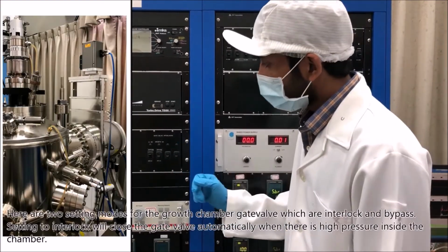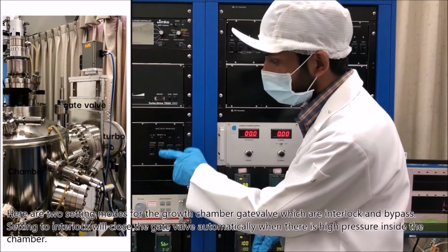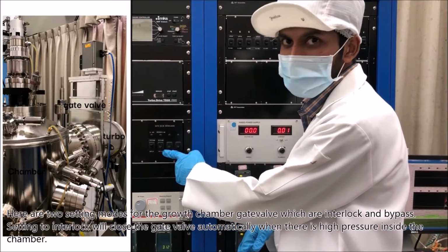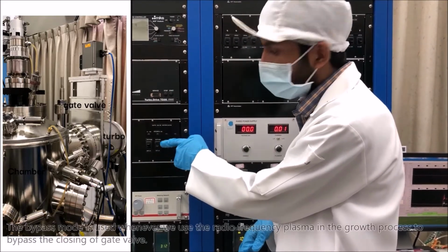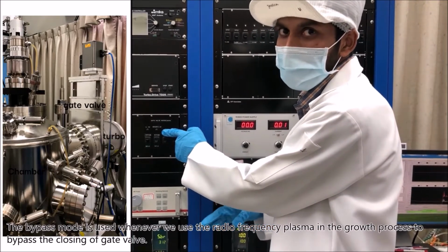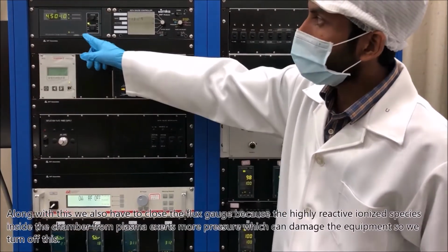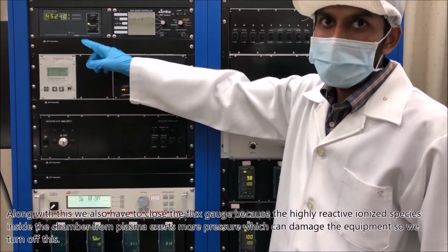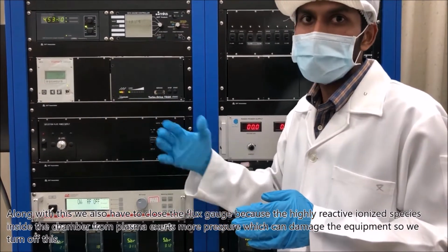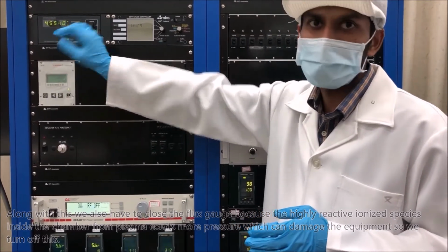Here are two setting modes for the growth chamber gate valve, which are interlock and bypass. Setting to interlock will close the gate valve automatically when there is high pressure inside the chamber. The bypass mode is used whenever we use the radio frequency plasma in the growth process, to bypass the closing of the gate valve. Along with this, we also have to close the flux gauge because the highly reactive ionized species inside the chamber from plasma exert more pressure, which can damage the equipment. So we turn off this one.